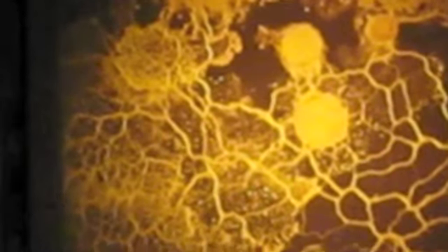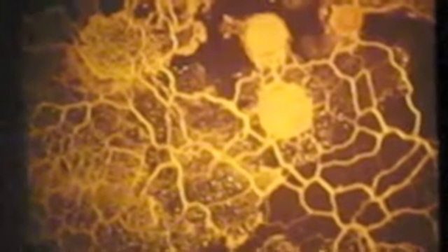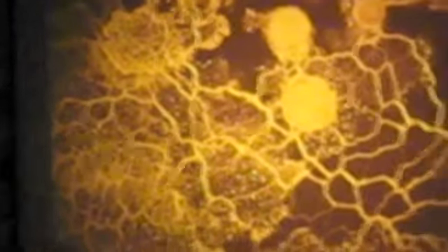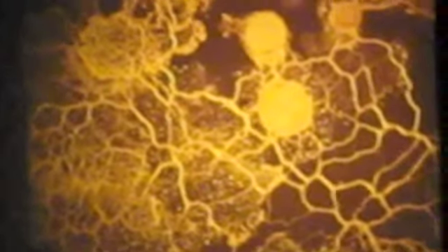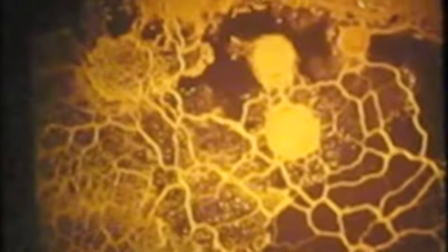What phylum? Myxomycota. What is this thing? What is the structure we're looking at called? Slime mold? It's a slime mold in English, yes, but what is the structure? What is that body called? Plasmodium. And what is its cellular nature? Cenocytic.